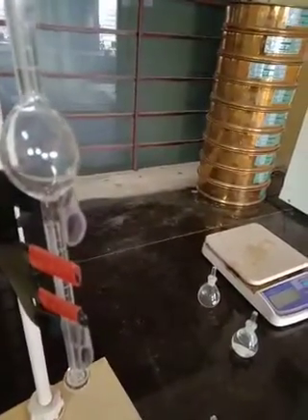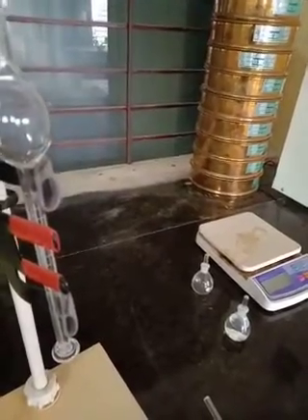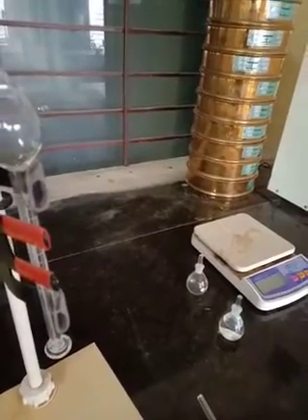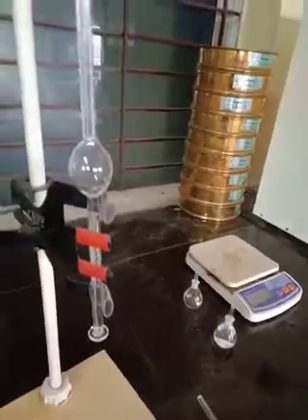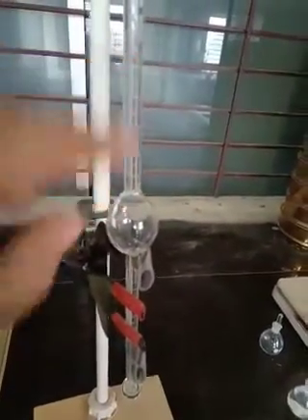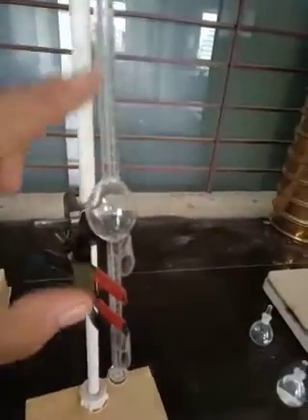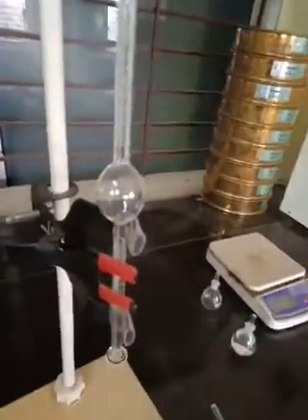Fill the stalagmometer with purified water and count the number of drops falling between the two points A and B on the instrument. Using fingertips, we control the flow so we can count how many drops fall. We repeat the reading at least three times.